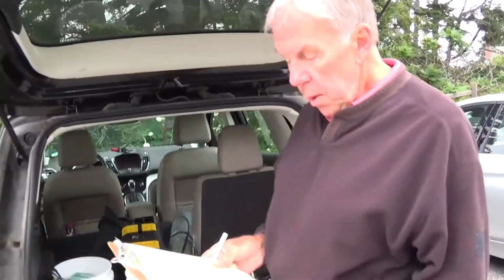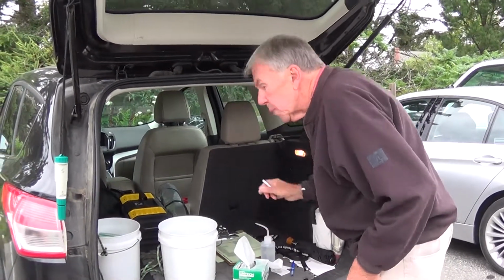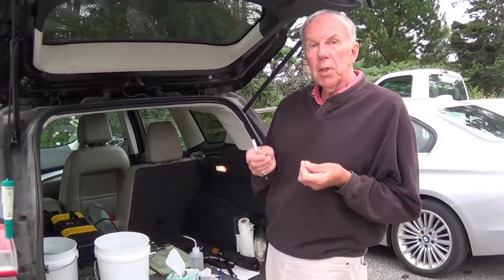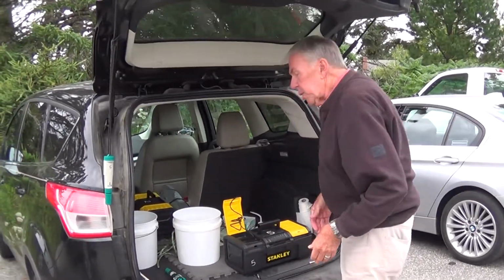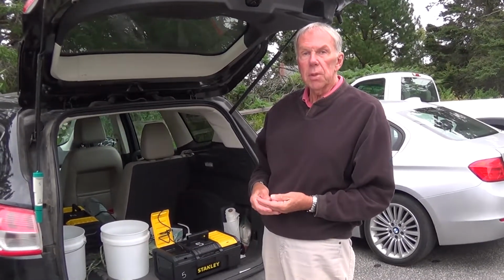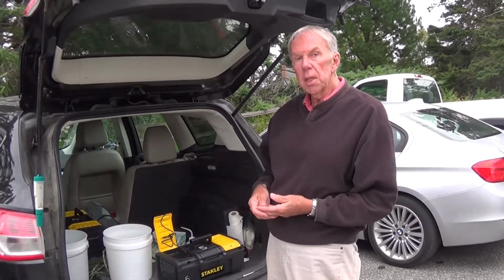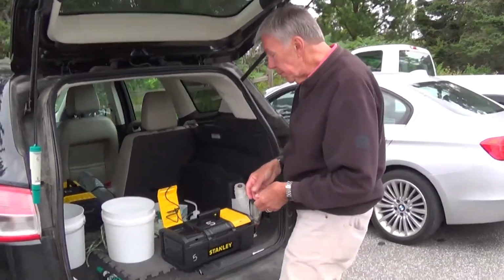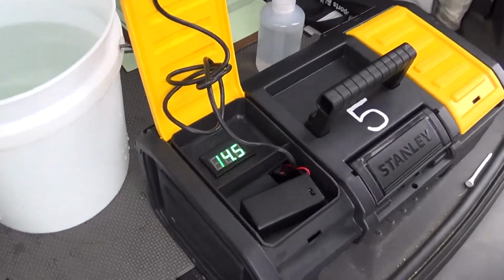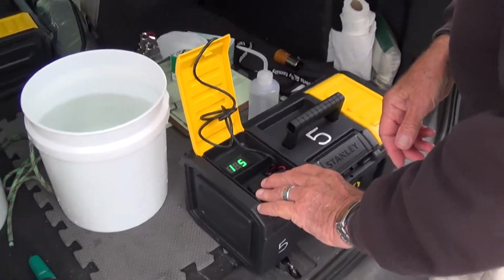Next we're going to do pH. And as I said before, pH is an instrument that you have to calibrate. So with the salinity, it was pre-calibrated at the Land Trust office. However, for pH, we need to do the calibration on site, and that's what we're going to do right now. By the way, we have 14.5 for air temperature. It's been about 5 minutes on a cloudy day, so we can assume that that's pretty good.